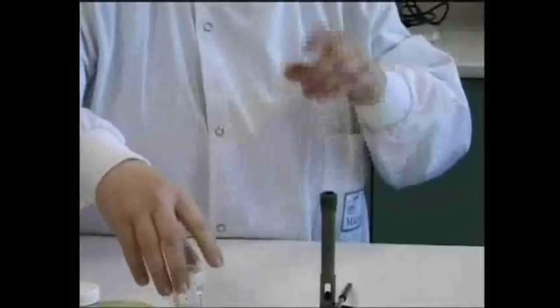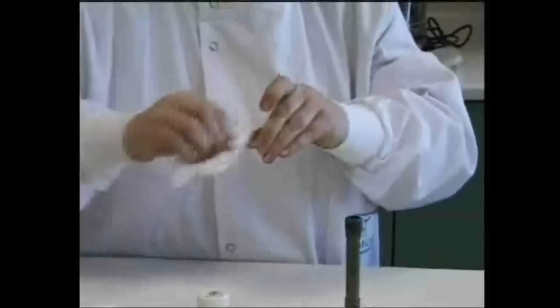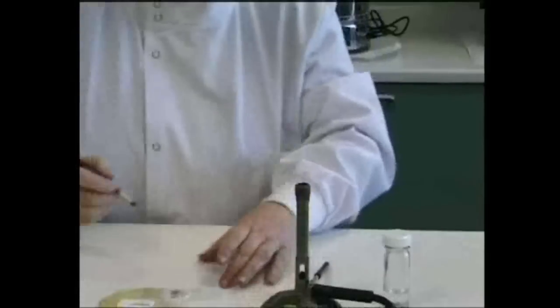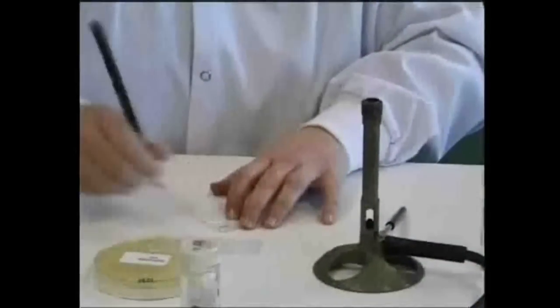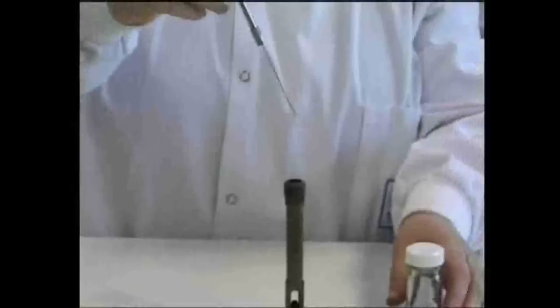To prepare a gram stain, you must firstly make a slide with a heat-fixed smear of the organism being investigated. Degrease the slide by breathing onto it and wiping it, and then label it with the name of the organism that you're going to stain. Flame a wire loop to sterilize it, and then place a loopful of water on the slide.